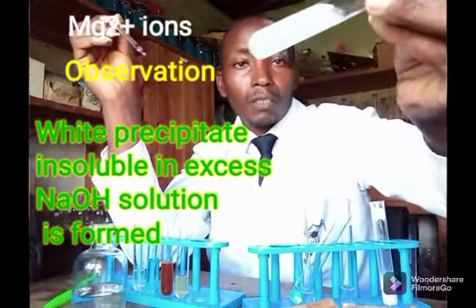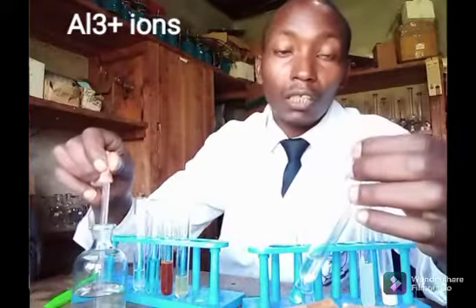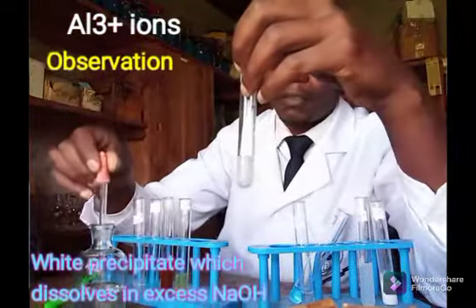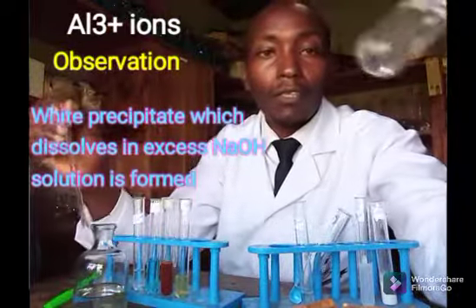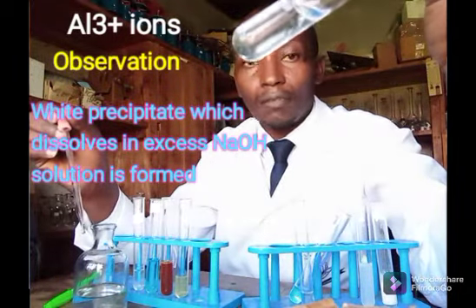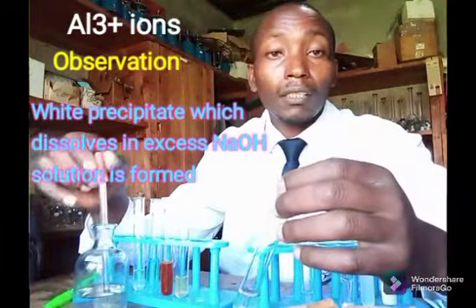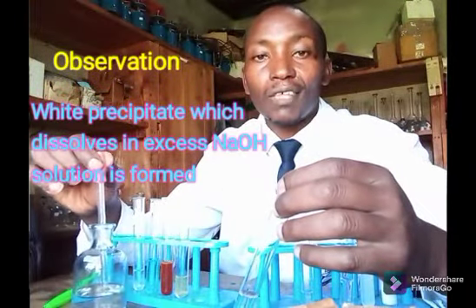Good, the precipitate remains. Next is a solution containing aluminium. So a white precipitate, it is. Then I add excess of it. Good. So you can see what has happened. The white precipitate has dissolved. With aluminium, the white precipitate has formed with a few drops. Then in excess, it has dissolved.